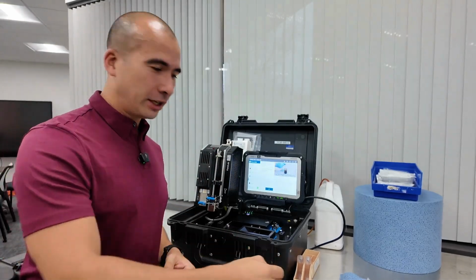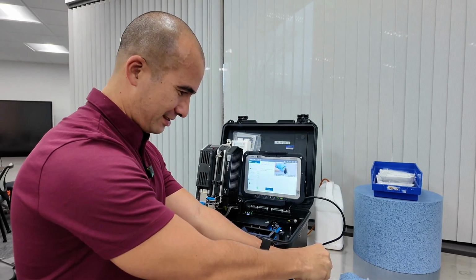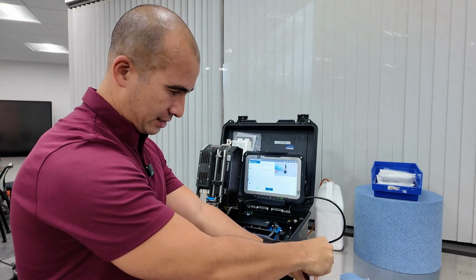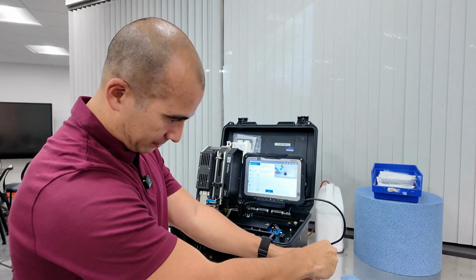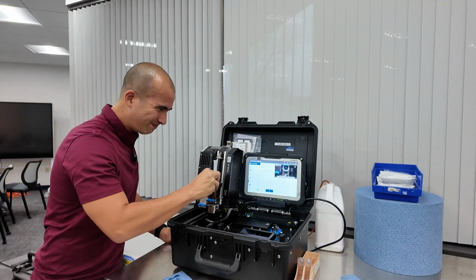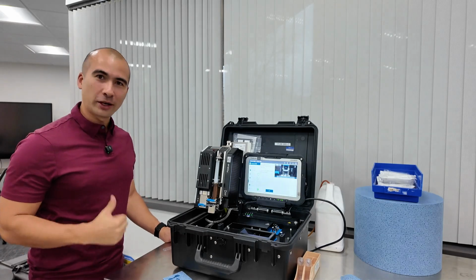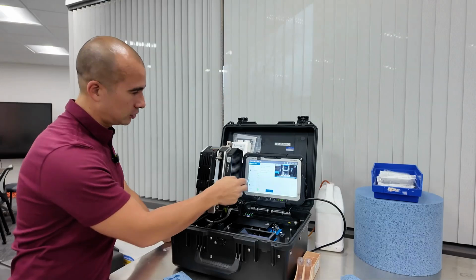Now, we're going to say we've already shaken up the bottle, pull out a sample, and we'll say approximately 12 mil. Oops, wrong one. All right, so here we go. Into the hole, push that in. Okay. All right, and then we just press start.